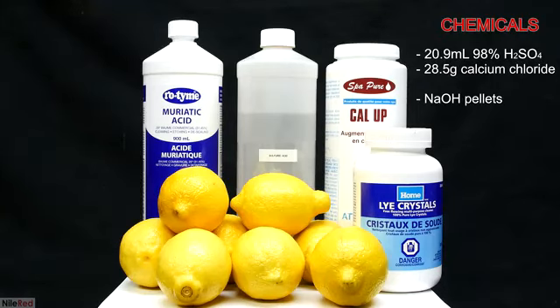Okay, so these are the supplies that I used. In the back, we have muriatic acid, concentrated sulfuric acid, and calcium chloride. In the front, there's a whole bunch of lemons, as well as some sodium hydroxide. Even though there's muriatic acid in this shot, it's not going to be used in this video. It's used in an optional washing step, and in this video, I decided not to do it.